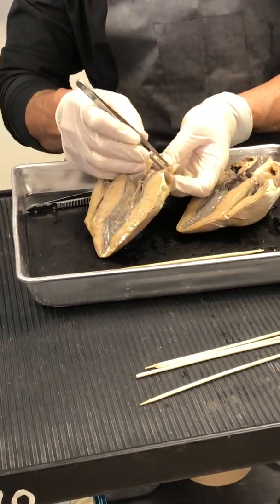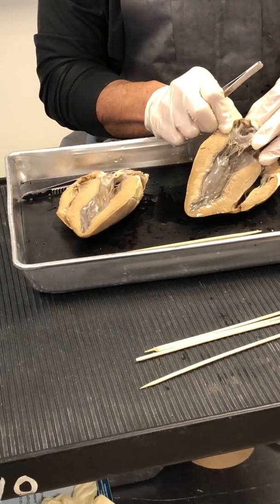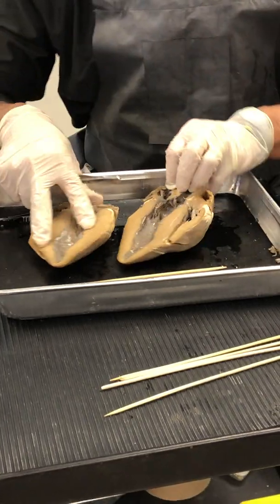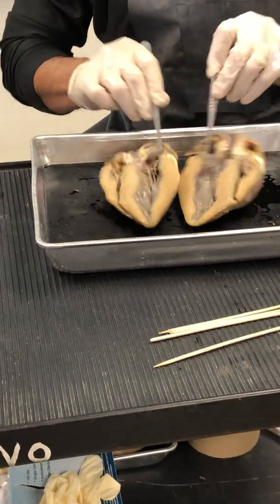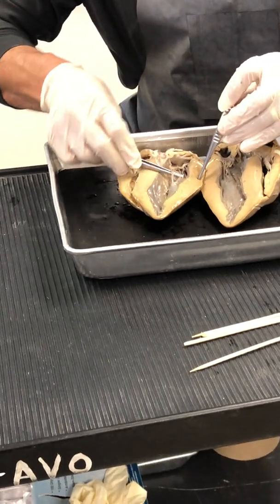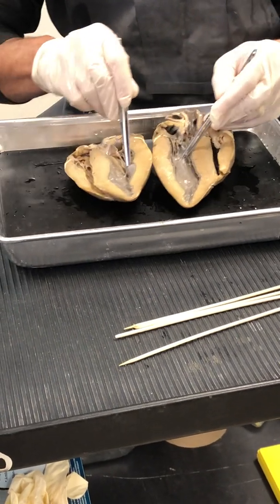There we see the bumpy muscles in the atria, folks, and the bumpy muscles in the atria are called the pectinate muscles. So you can see the pectinate, we've seen the papillary, we've seen the trabeculae carneae, right? So there's now my left atrium, both sides. There is my bicuspid valve, both sides. There's my chordae tendineae, both sides. There's my papillary muscles, both sides.